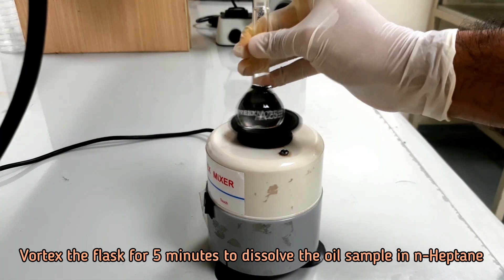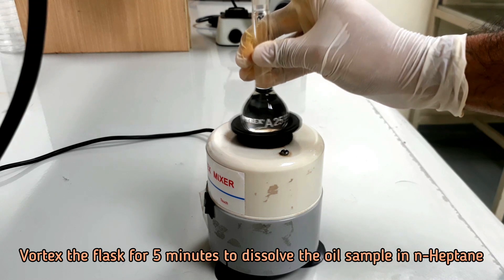Vortex the flask for 5 minutes to dissolve the oil sample in n-heptane completely.